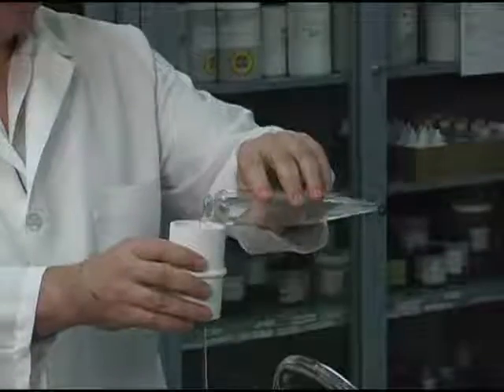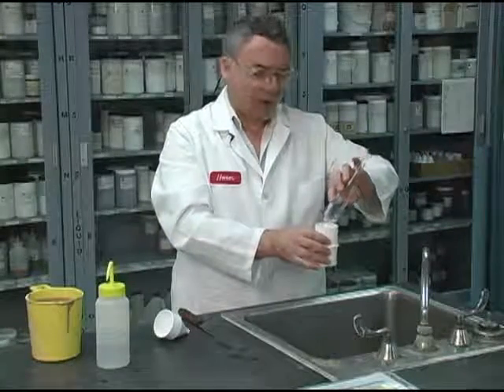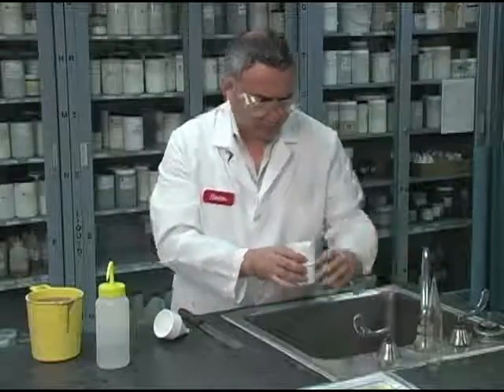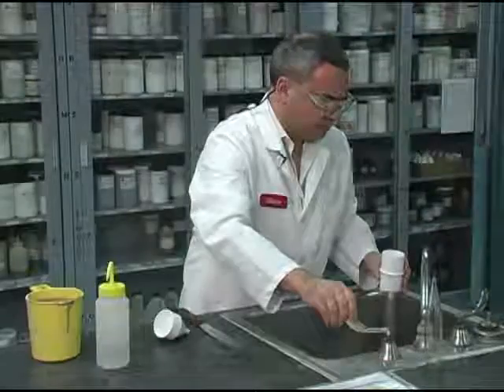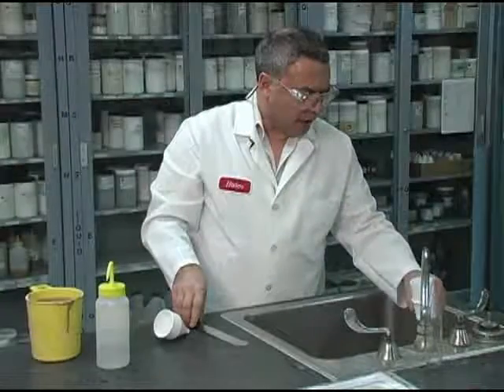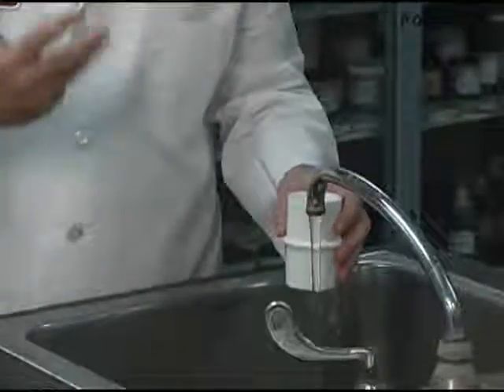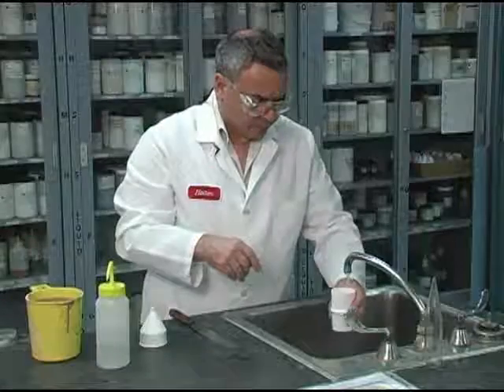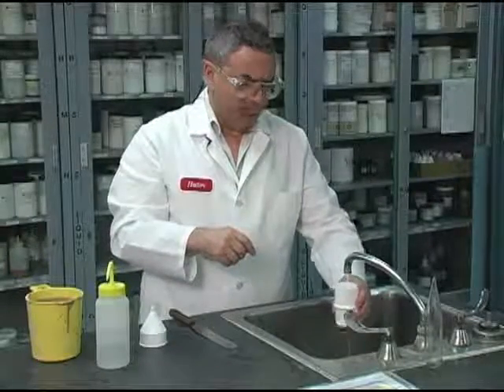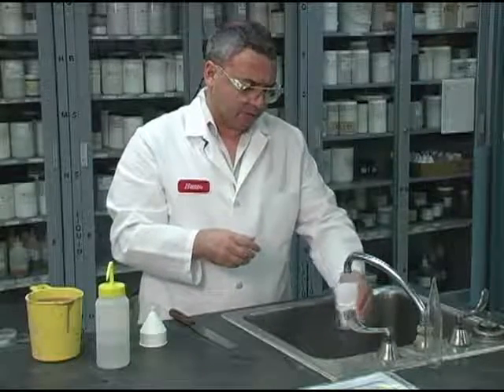And at the same time I'm doing this, I'm kind of rinsing and making sure that all the particles that are below 74 microns go through. Matter of fact, I'm done with this. I'm going to continue rinsing this. What I'm doing now is getting water to flow to make sure that all the particles which are not strictly sand go through the mesh, the 200 mesh. If I don't do this very carefully, I'm going to be seeing sand where in reality there is a lot of particles which are not sands, are probably silts, and maybe even clays.